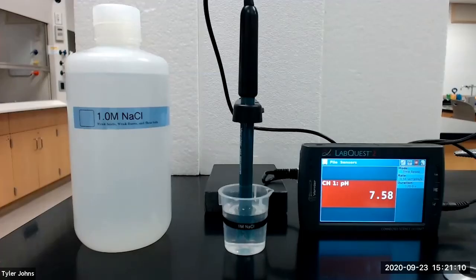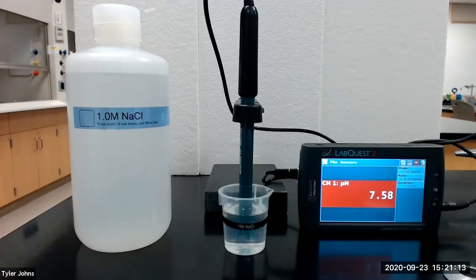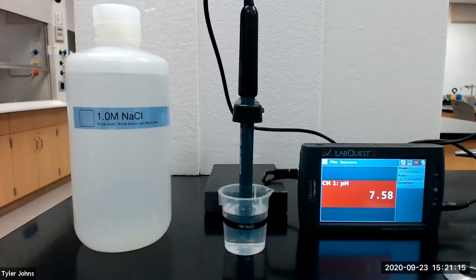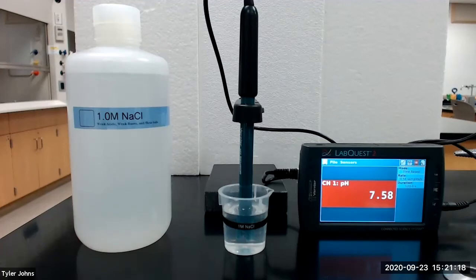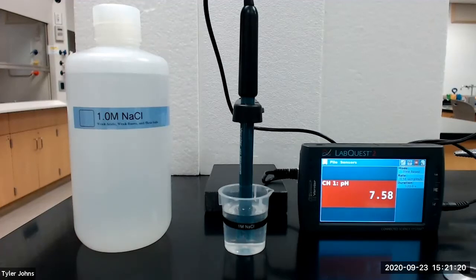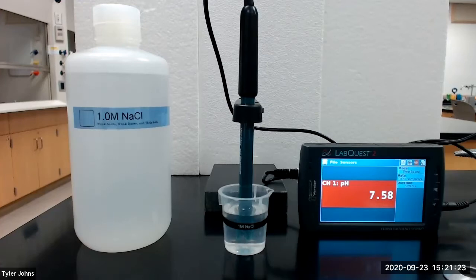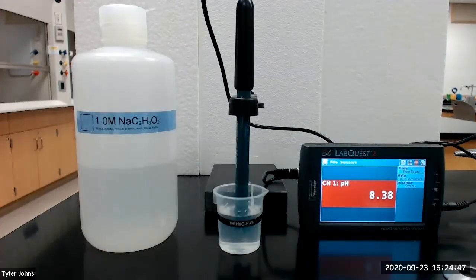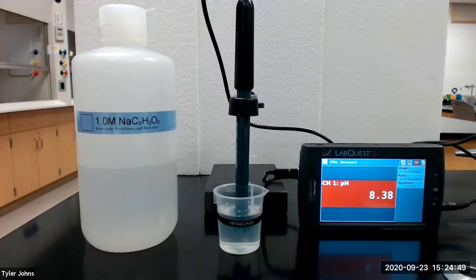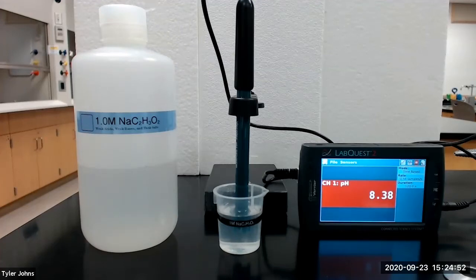Let's get started. In part one of this experiment we will be measuring the pH of salts. The first salt that we will be using is sodium chloride. The pH of our 1.0 molar sodium chloride solution is 7.58. Our next salt solution is 1.0 molar sodium acetate and it has a pH of 8.38.